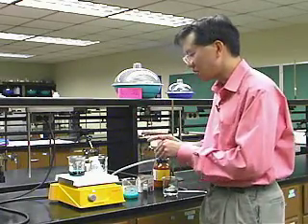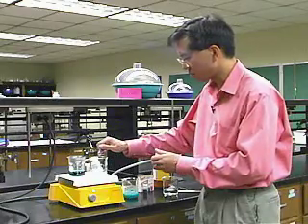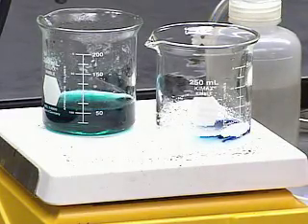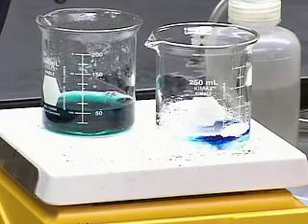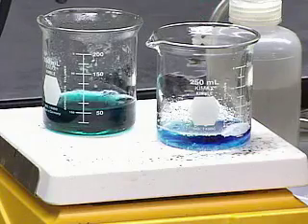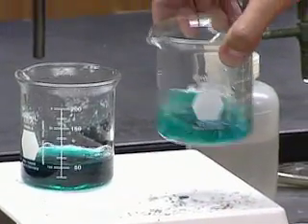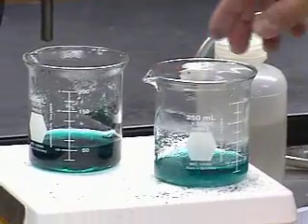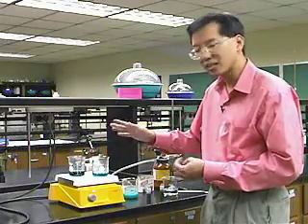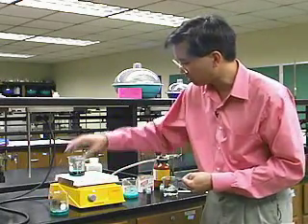Now, to make it more interesting, what I'm going to do is add some food coloring to this solution. Think of the food coloring as some sort of impurity that might be present in the aspirin. It doesn't have to be food coloring, but the point is I can add food coloring to this mixture. Now I have a mixture of acetylsalicylic acid and water, and food coloring as well. Again, I'm going to add enough water until it is fully dissolved, right at the solubility limit. And I've done that already here.